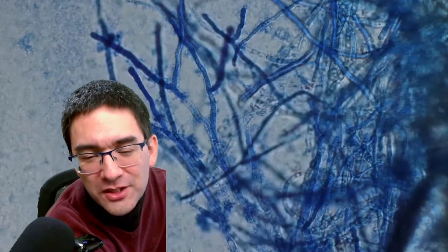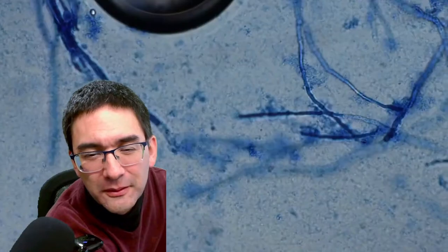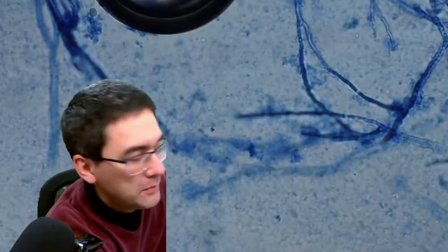I mean, it's not necessary because fungi are quite easy to observe anyway, because they generally have enough contrast anyway, but still. So let's have a look. Maybe I should also try the staining reaction on the other one, where I've got only the spores. Let's see how that stains.